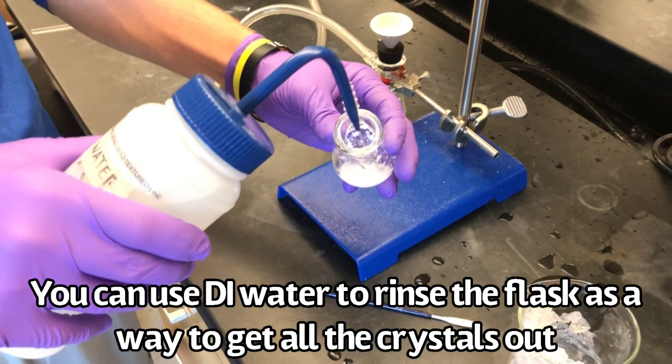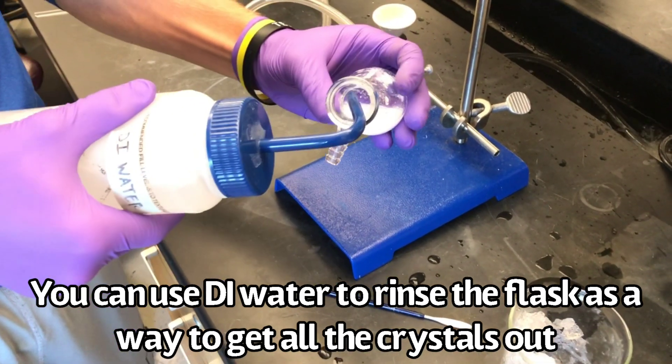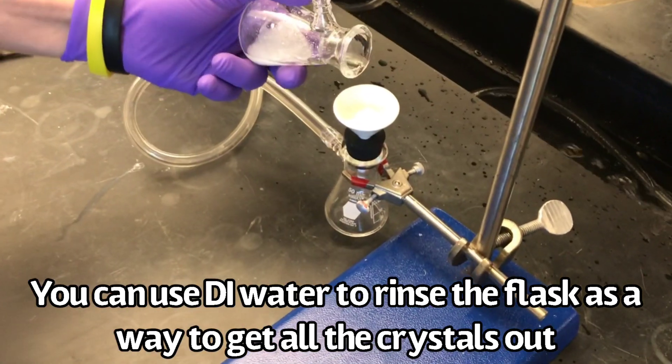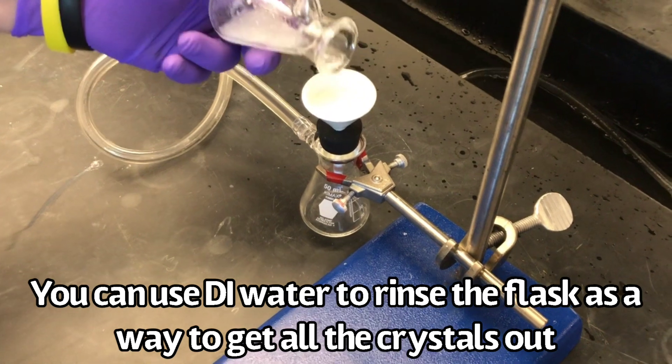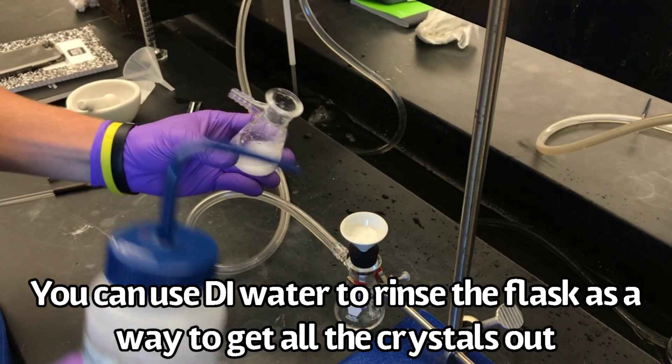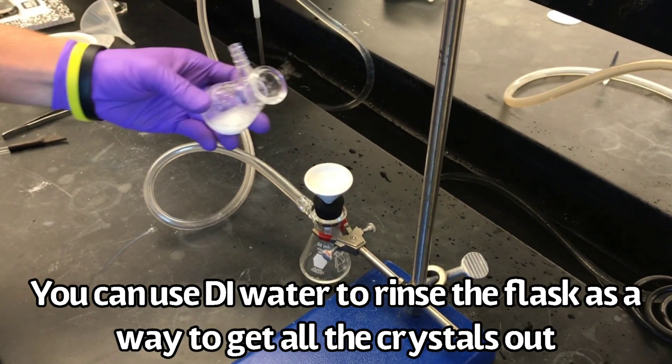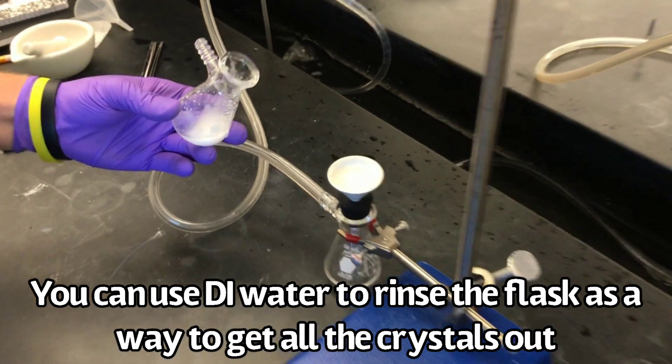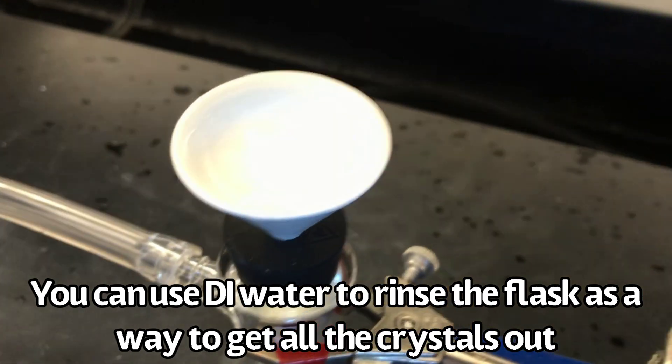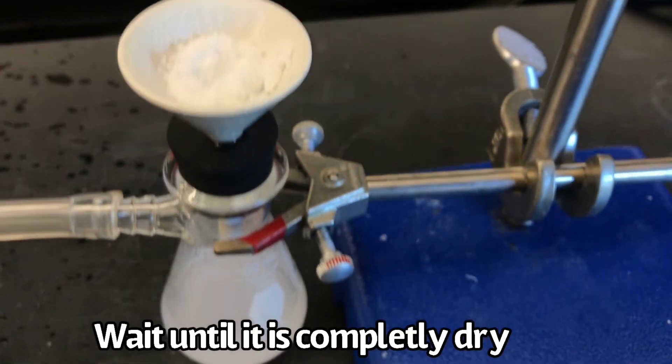Rinse the flask with DI water to get all the crystals out. Wait until completely dry.